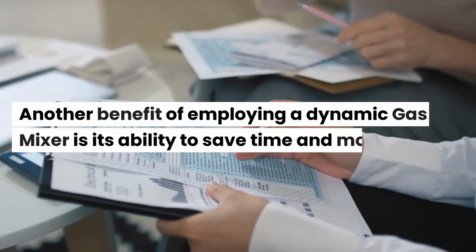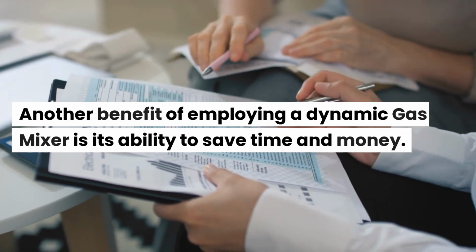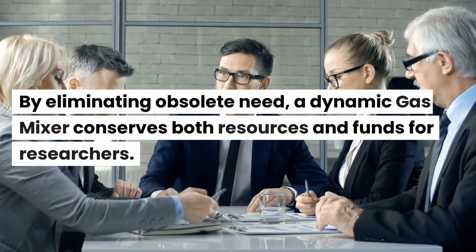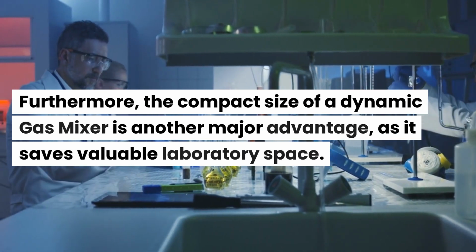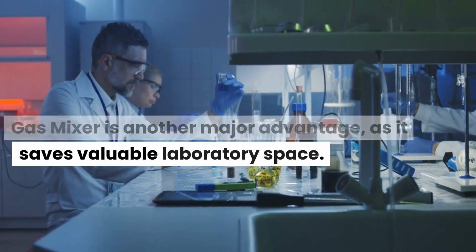Another benefit of employing a dynamic gas mixer is its ability to save time and money. By eliminating obsolete needs, a dynamic gas mixer conserves both resources and funds for researchers. Furthermore, the compact size of a dynamic gas mixer is another major advantage, as it saves valuable laboratory space.